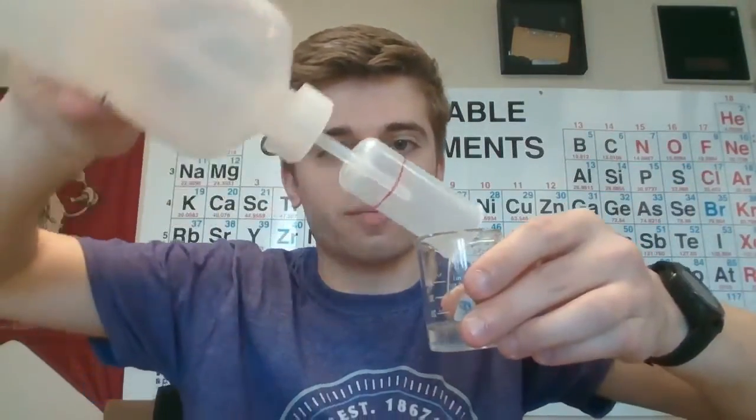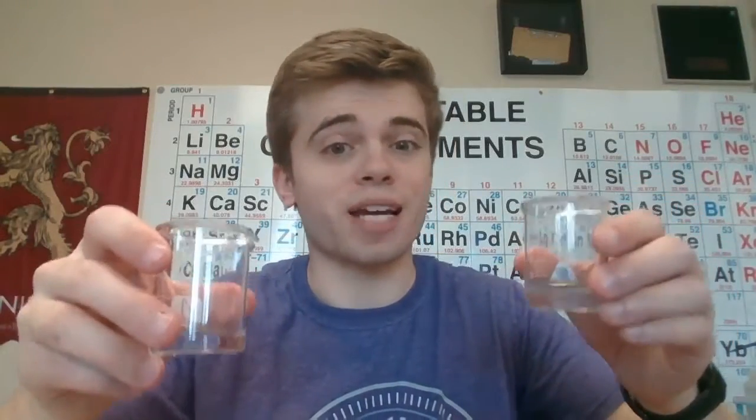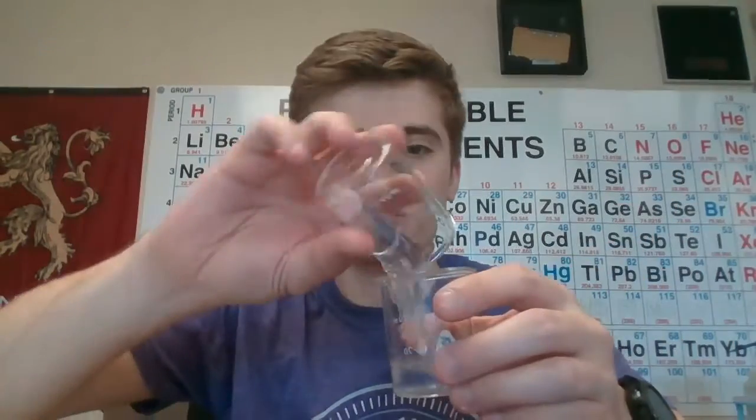Okay, we're starting our second to last trial. This time we're mixing together that 10 milliliters of B, which I've measured here, and we're mixing together only 6 milliliters of solution A and 4 milliliters of water, which I mixed together in this graduated cylinder. So as soon as I mix these together, go ahead and start those timers and time how long it takes to turn blue. So we're mixing.